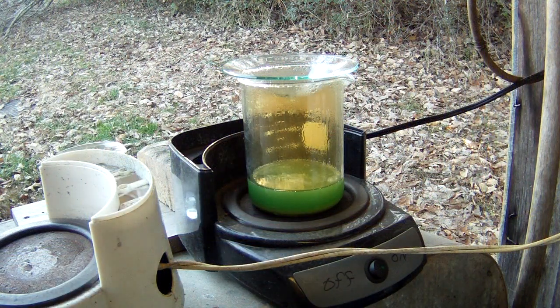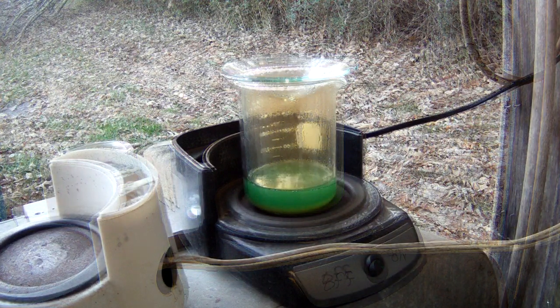Okay guys, about another 15 or 20 minutes has gone by. As you can see, we're getting a little bit of NOx in there now. But we're still having a good reaction. I think about half of our material has dissolved. So I was just giving you a little quick update on it. We're going to let it go till it slows to almost nothing, and then I will look and see how much junk we got in the bottom there and try to determine if we need to add any more nitric or not. But we still have a pretty good reaction going, so we're just going to let it play out, and we'll get back to you in a little bit.